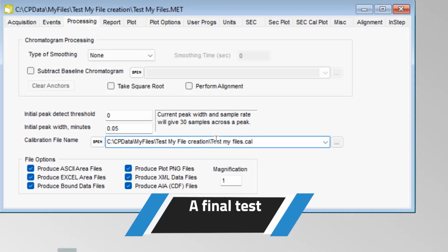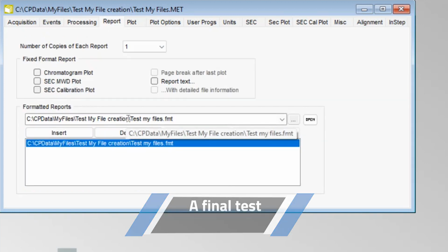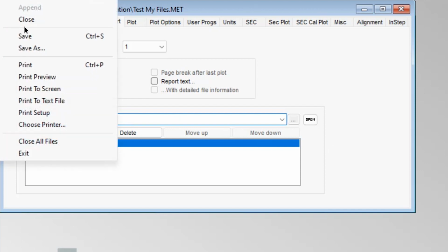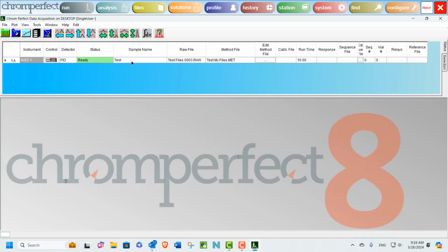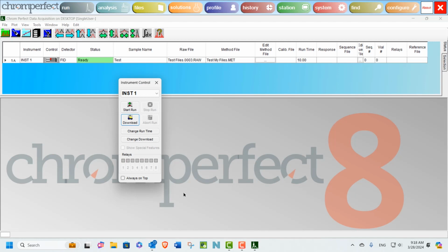Let's do one final test. Now we have our search directories established. On screen now, I am changing our method file and removing the path for calibration and format files. Only the file name will remain with its extension. Of course, the software will still find the files if the path is present, but including search directories means that a file path is no longer essential. Now let's test that even without the associated path being included, Chromperfect will correctly process the data and create our auxiliary files.